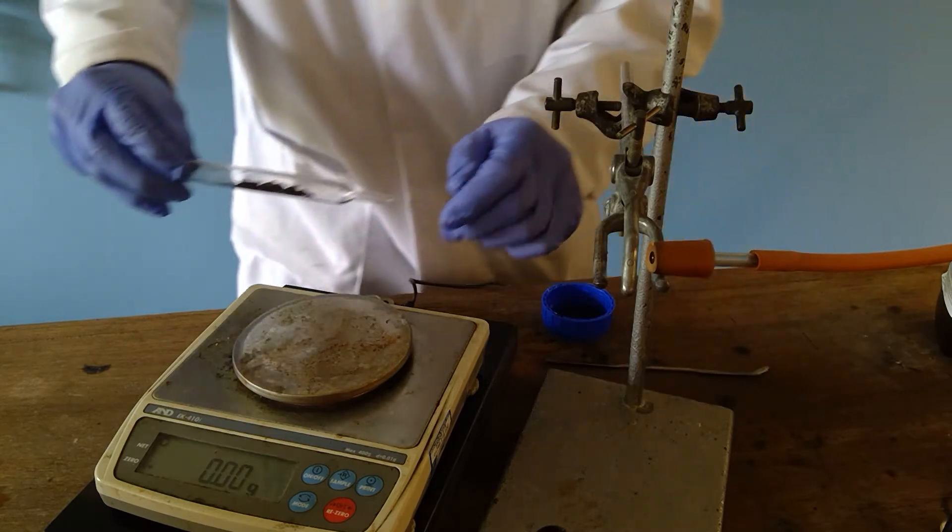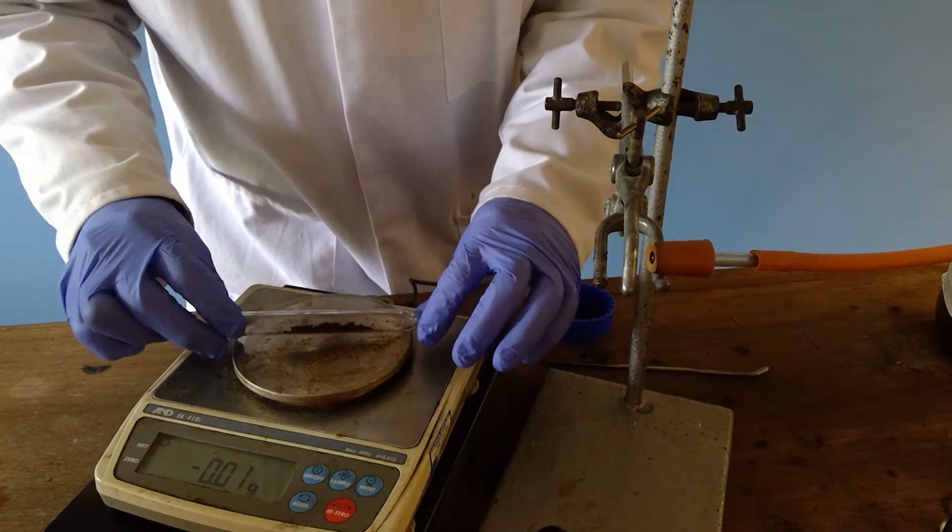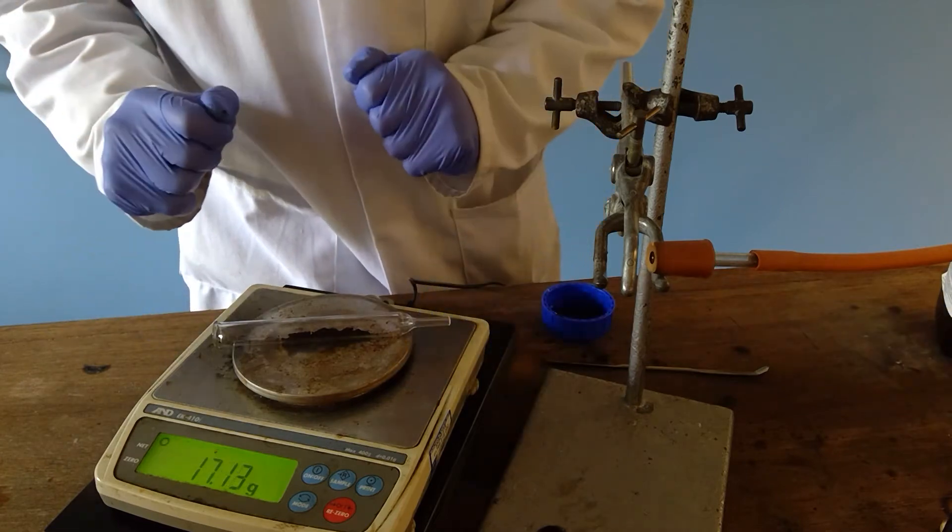So take a note of the new mass of the copper oxide and the combustion tube.